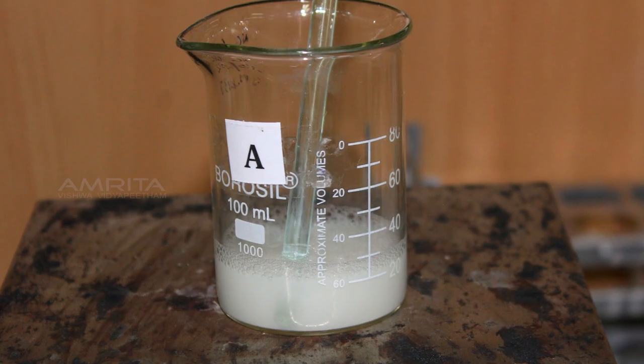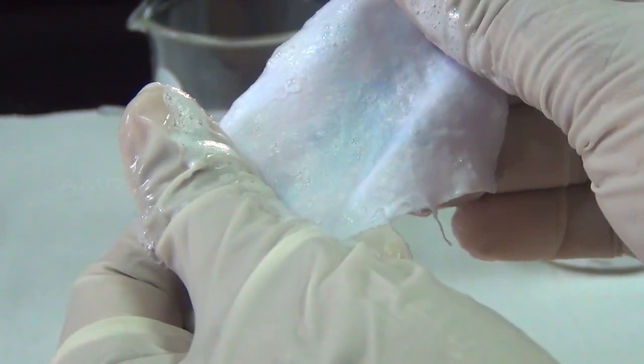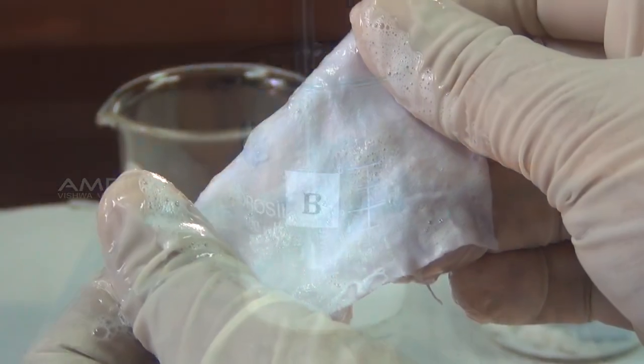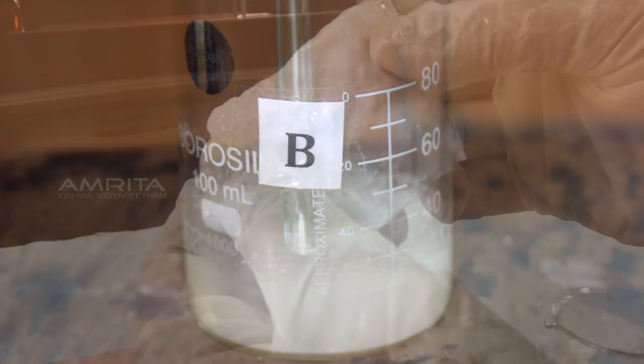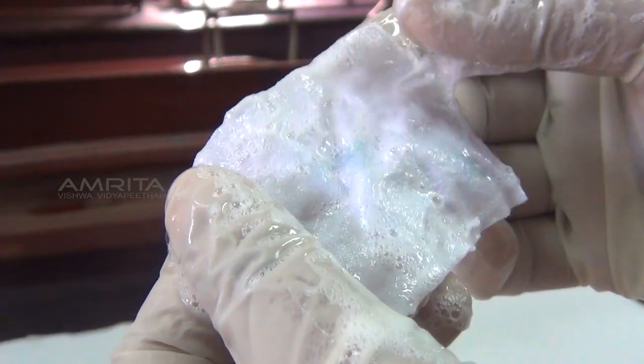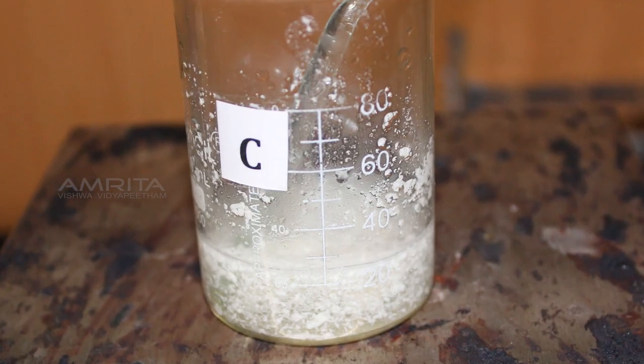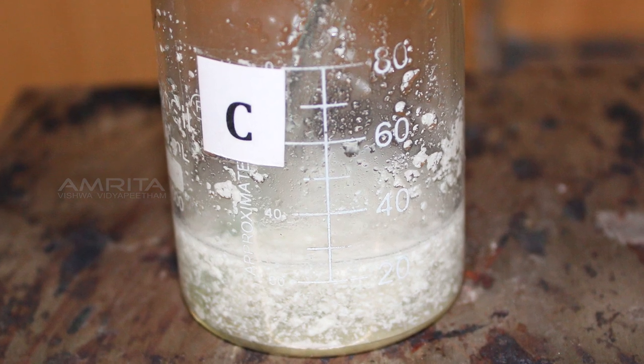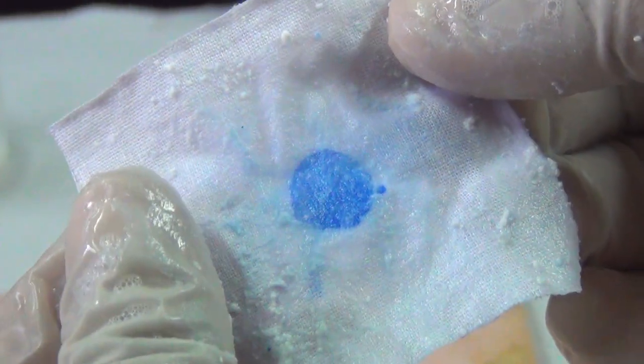Soap solution with distilled water, i.e. soft water, has the most cleansing capability. Soap solution with well water, i.e. hard water, has less cleansing capability than soft water. Soap solution with distilled water with calcium chloride dissolved in it is very hard water and has the least cleansing capability.